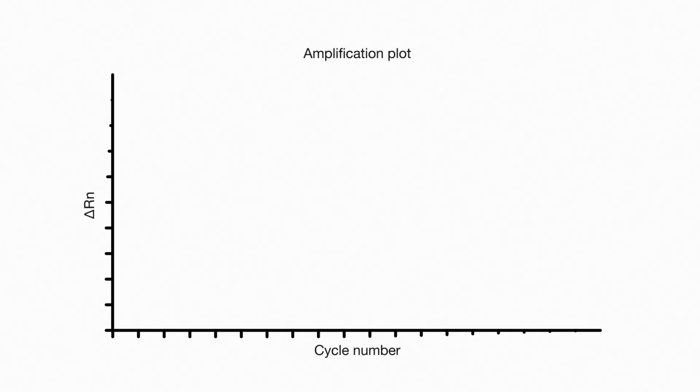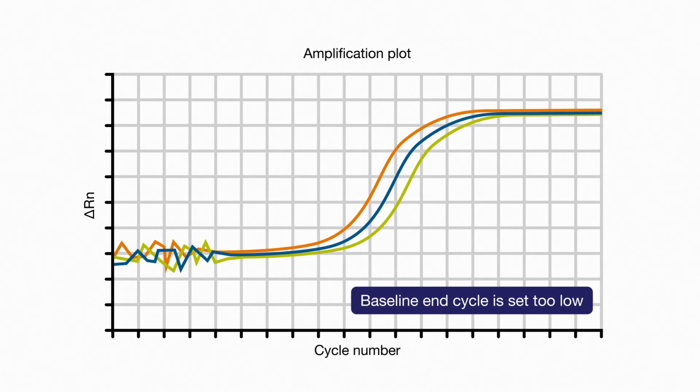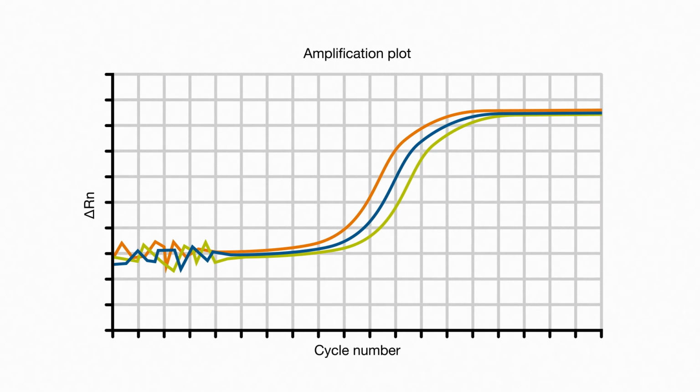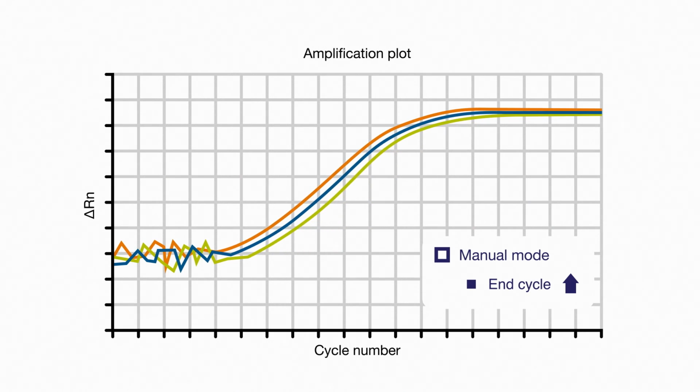You'll know auto baseline has malfunctioned by the shapes of your curves. If they look more S-shaped than they should, it could be that auto has misapplied the baseline and set the end cycle too low. As a result, not enough noise is being subtracted and the curves take on that strange shape. To fix the problem, switch over to manual mode for that assay and raise the end cycle until the curves take on a regular shape.